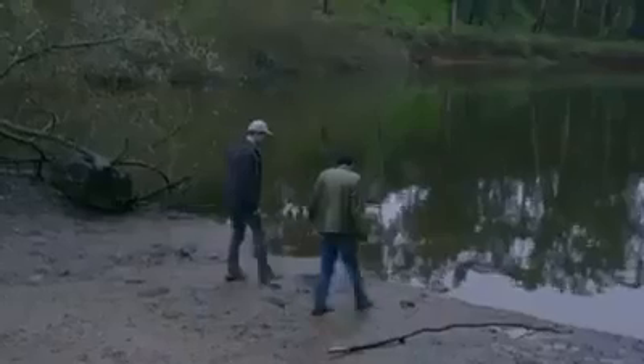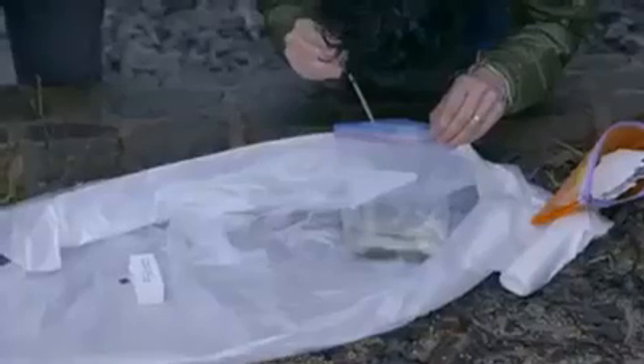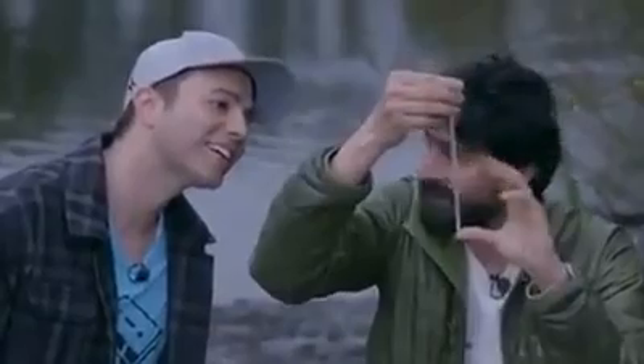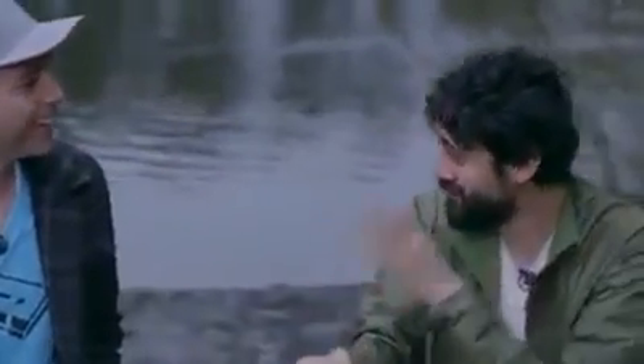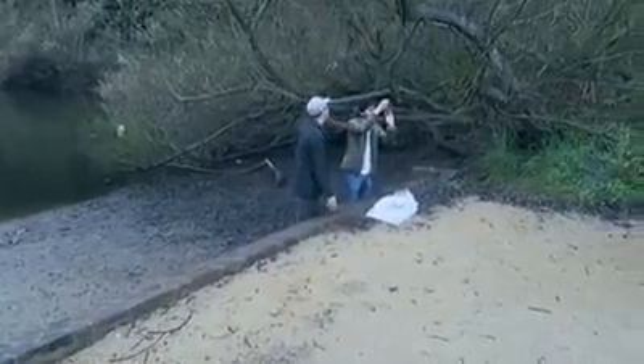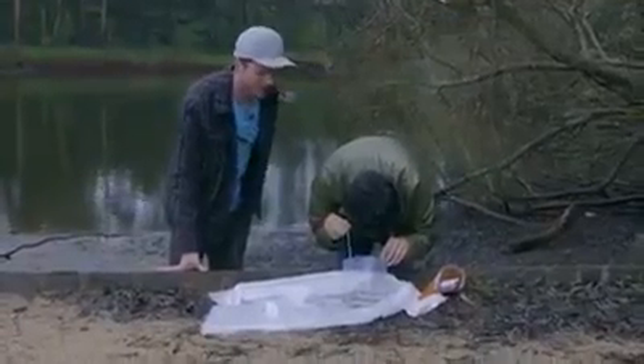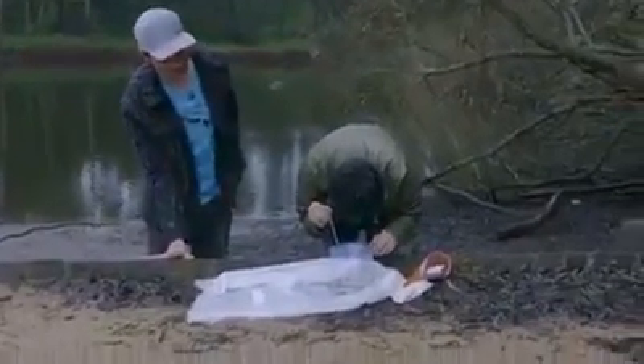I wanted to test drive this paper microscope. We got a scoop of seemingly clear water from this pond, and there was one tiny white speck that didn't settle to the bottom of our bag, so Manu suggested we take a closer look. They can sense suction and they run away — it's kind of like a fly when you're trying to swat it. It senses your hand coming before it comes, and it realizes it's about to go into the mouth of a fish, so it runs away.